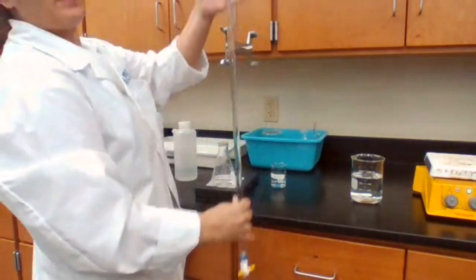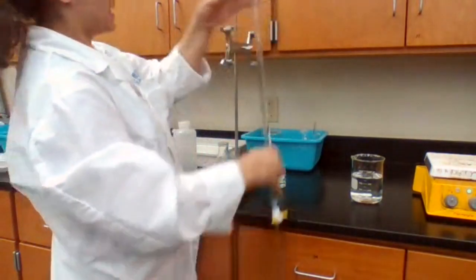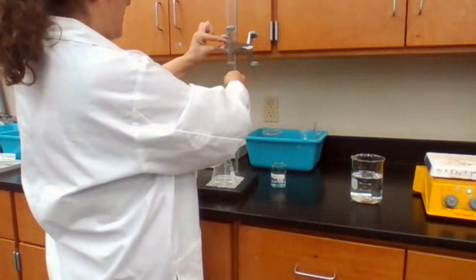Okay, just want to make sure the meniscus is exactly at 0.